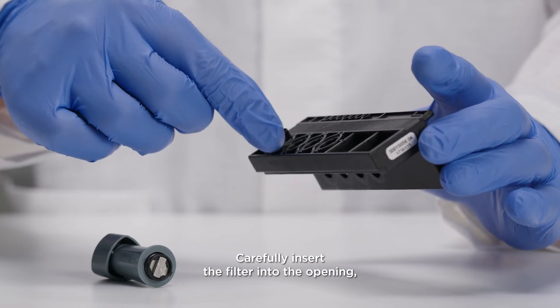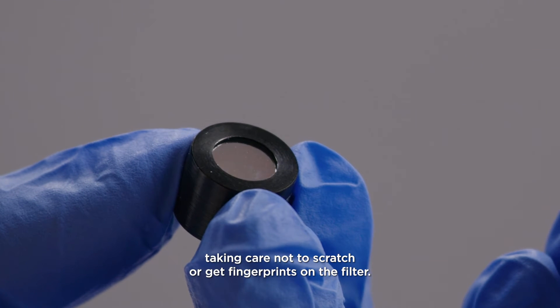Carefully insert the filter into the opening, taking care not to scratch or get fingerprints on the filter.